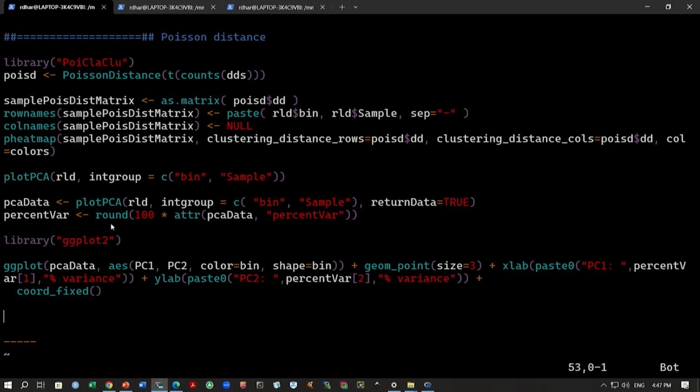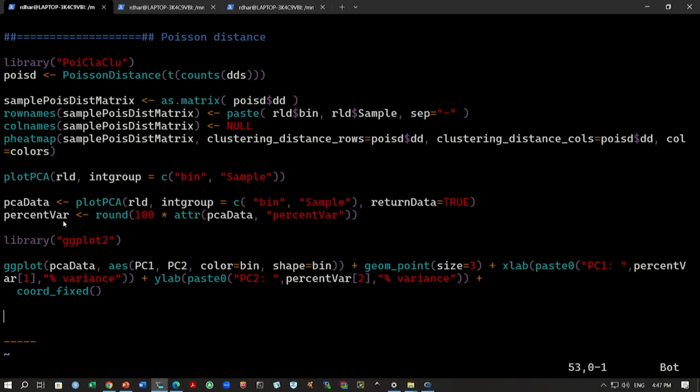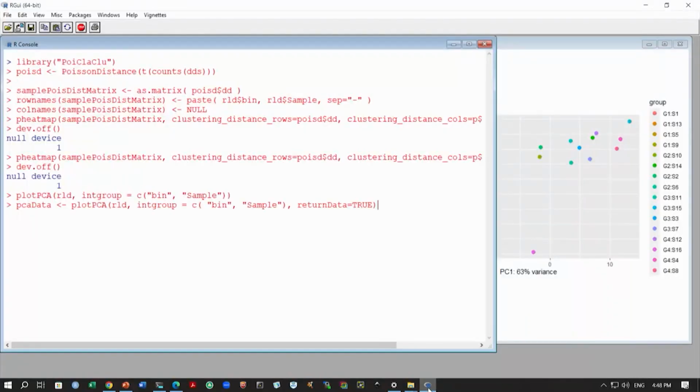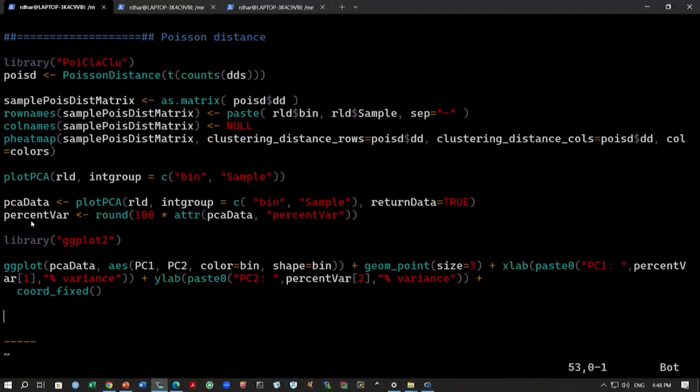So, we generate this PCA data from this plotPCA function, again using the R-log transform data, and this will store this data inside this PCA data variable. So, we can run this first command here. This will do the PCA and store the results in this PCA data variable. So, this is done now, we have stored this, and it will also calculate the percentage variation that is explained by this PCA data.